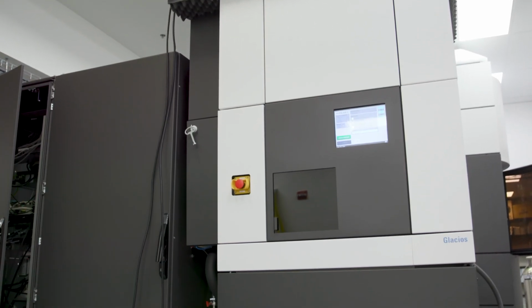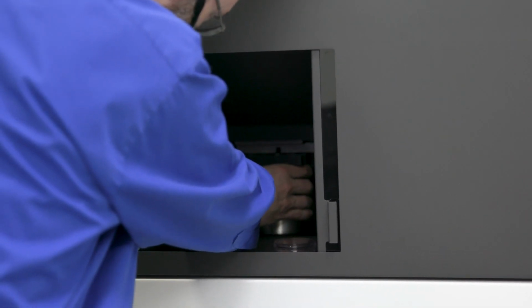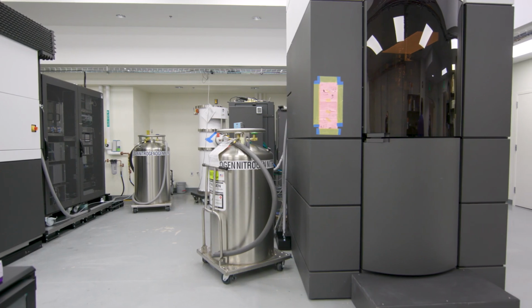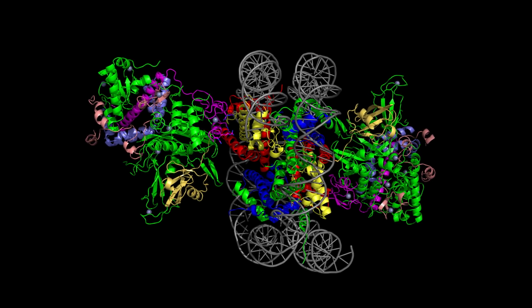Dr. Beckman had a well-known reputation and legacy for being a pioneer in instrumentation development. And he made no secret of his viewpoint that instrumentation is a major driver of scientific discovery. And at Johns Hopkins, we completely buy into that perspective. We also believe that in order to make discoveries, you really need to be able to do measurements of all different kinds, depending on the field that one is in. But we'd like to think that by conducting the science that we are with the instrumentations that we use, many of which were developed by Dr. Beckman, that we are continuing in his legacy.